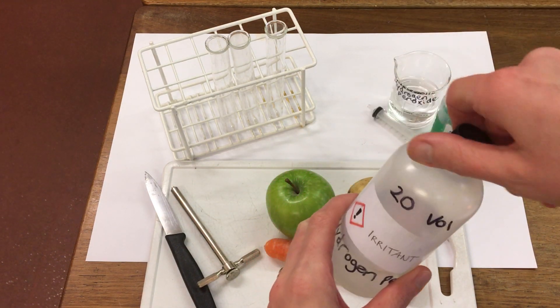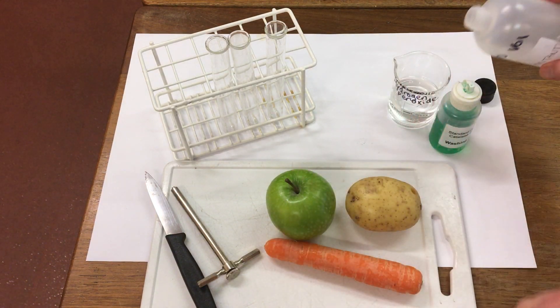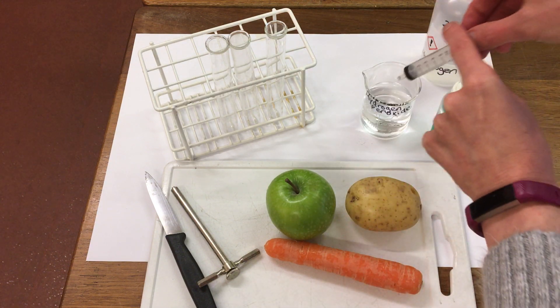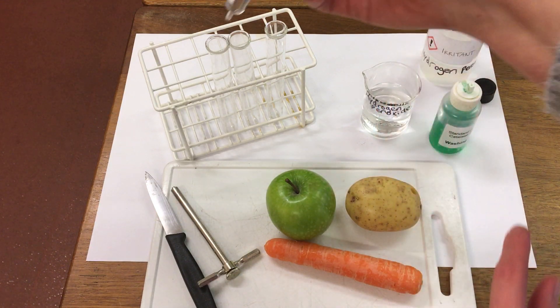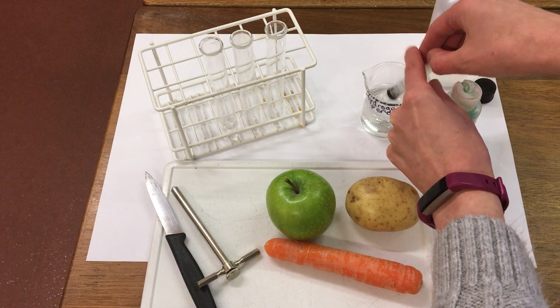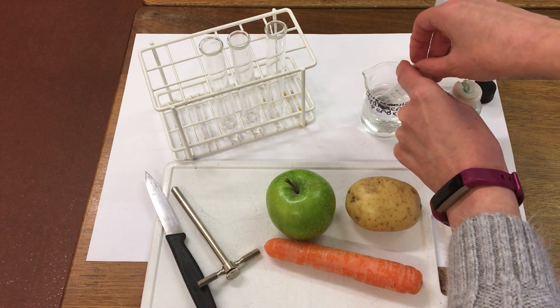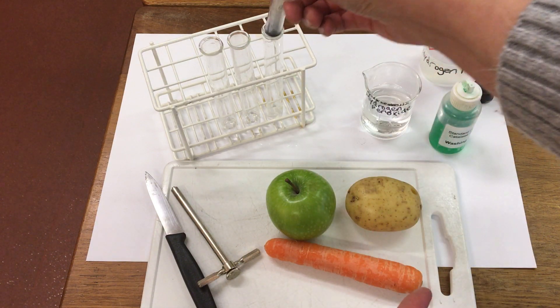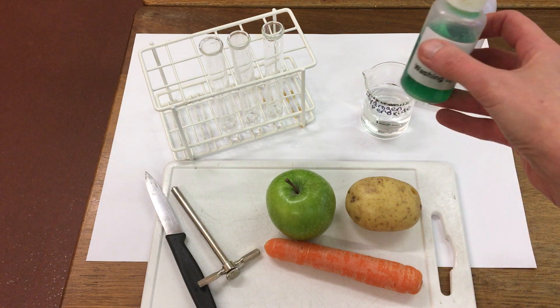First of all, I'm going to take our hydrogen peroxide and I'm going to put 2 ml into each of our test tubes. And then, so we can compare the speed of the reaction, I'm going to add 2 drops of detergent.